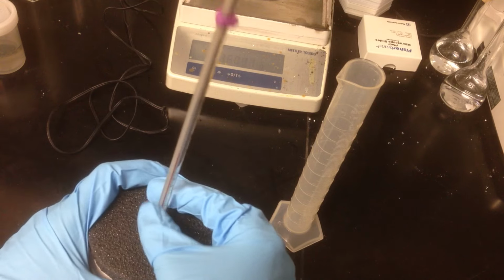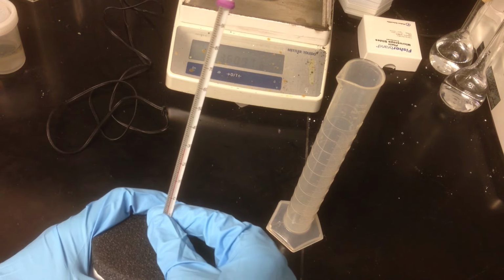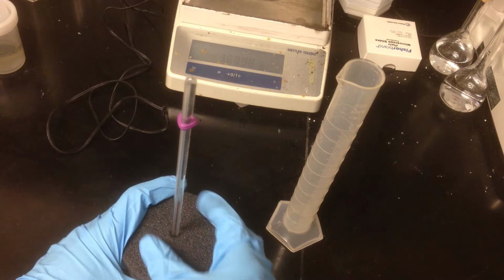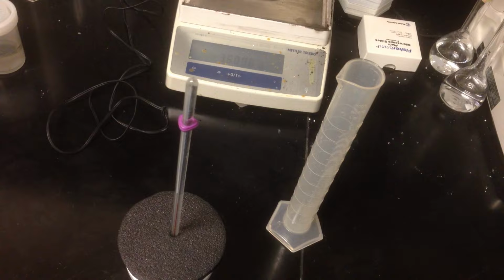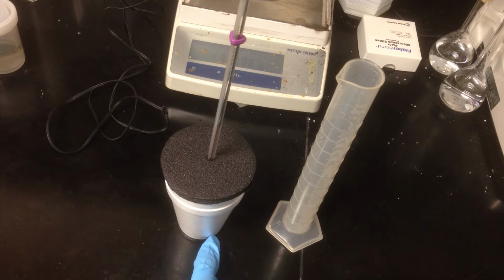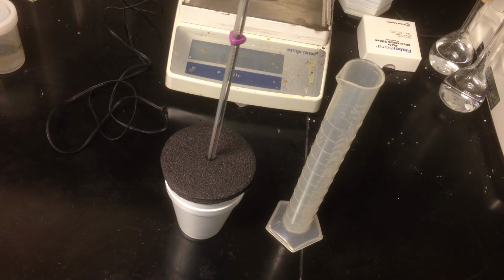So the reaction mixture appears to be topping out at about 28.0 degrees Celsius, so we use that as our equilibrium temperature, and the difference between the initial and the final or equilibrium temperature will give us a hint to the enthalpy change associated with this reaction. Do note, however, that you'll have to use the calorimeter constant because some of the heat released or absorbed by the reacting components either goes to or comes from the calorimeter walls.